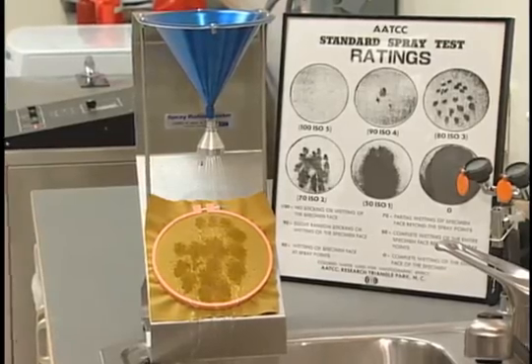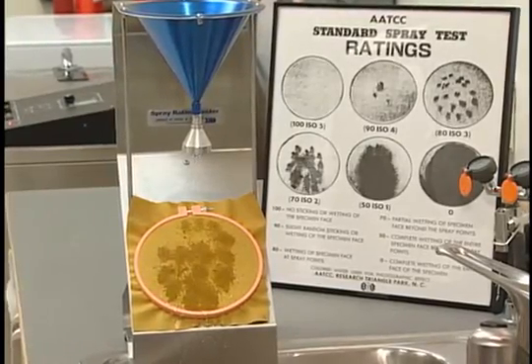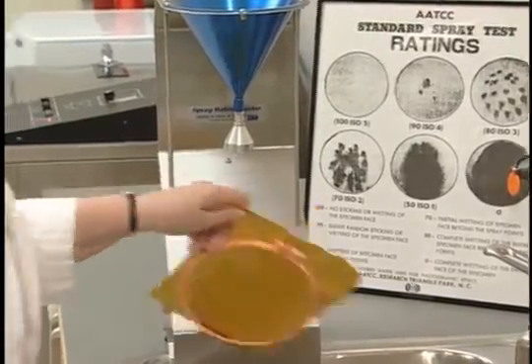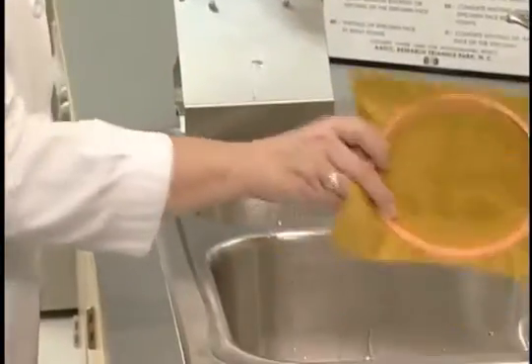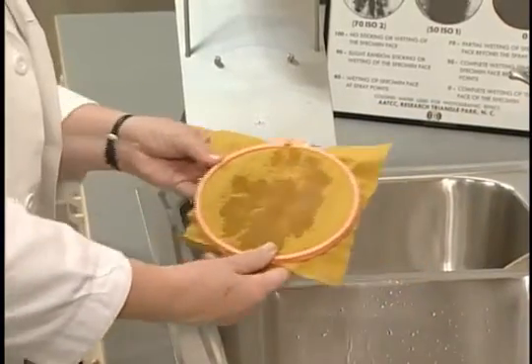After the real test is performed, take the hoop at its lowest point and tap it firmly against the edge of the lab sink at the opposite point on the hoop. Rotate the hoop 180 degrees and tap once more at the point the hoop was previously held.